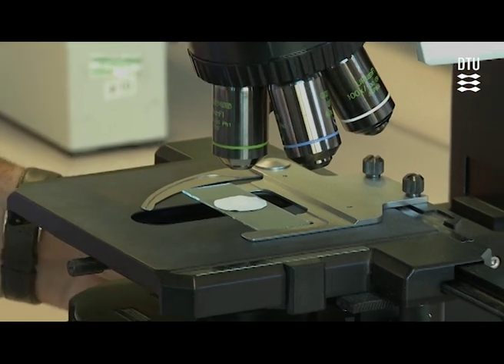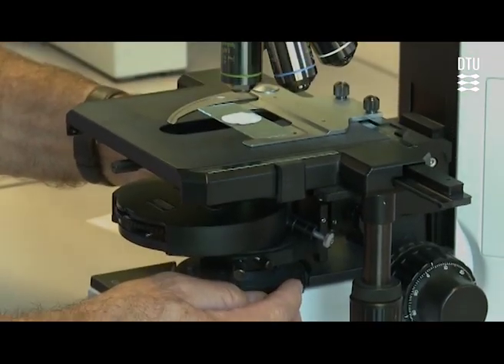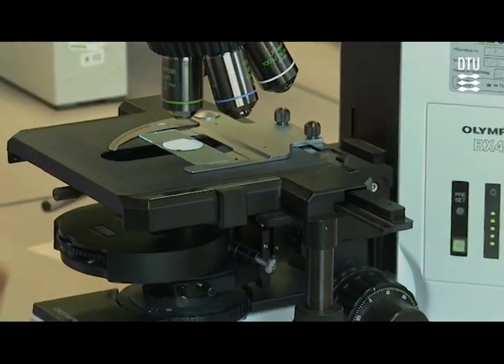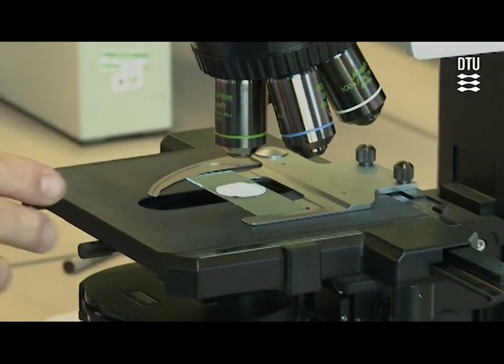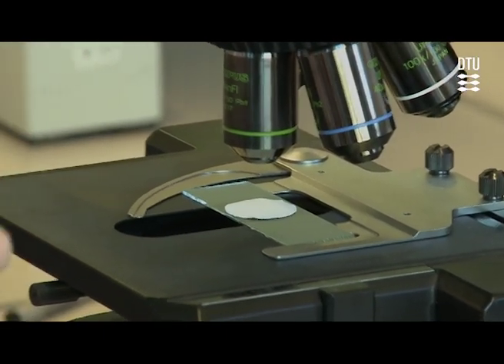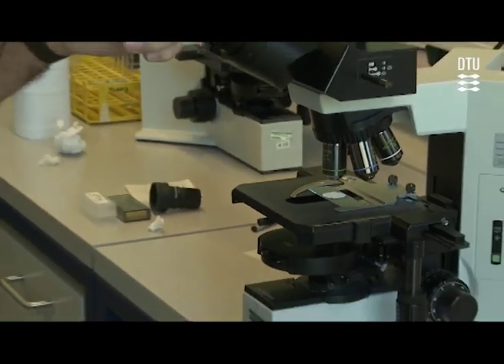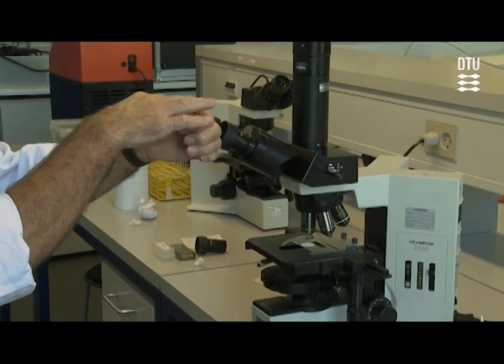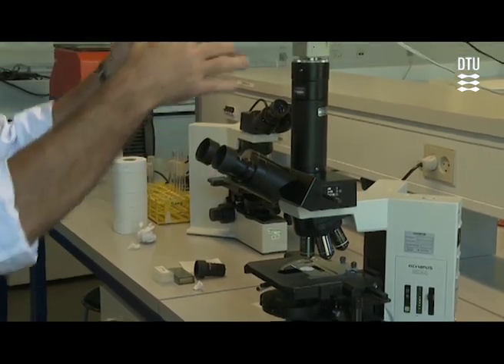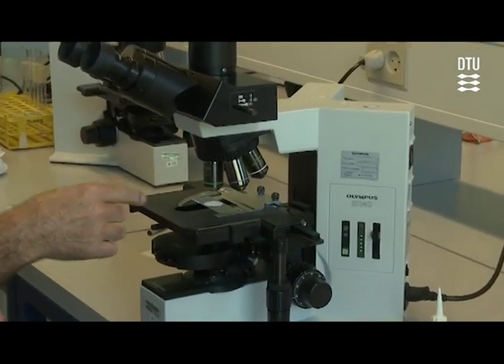And this is exactly what we are trying to show you, because this ring is the clue to how phase contrast microscopy works. When we illuminate through this ring aperture, the cone of light will be smaller and smaller until it hits the specimen, and then it'll be projected up into the ocular afterwards. It's only the ring of light that goes through.